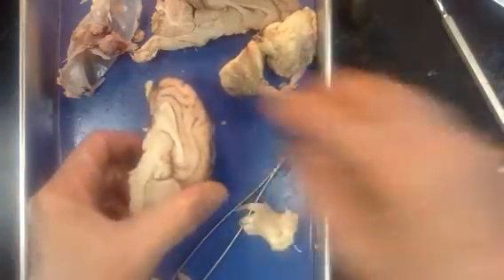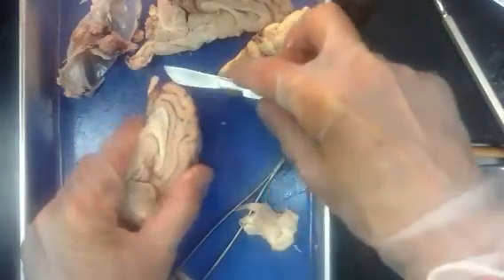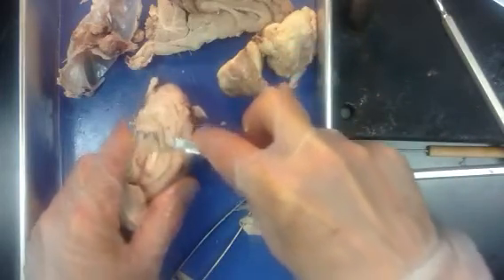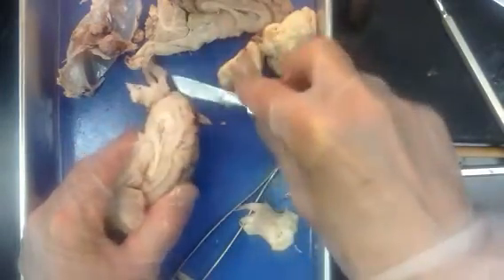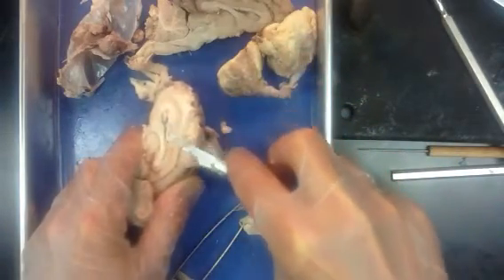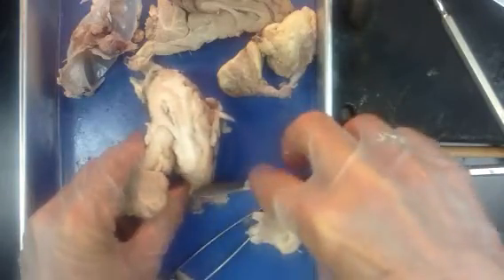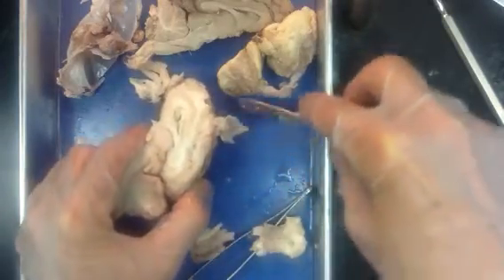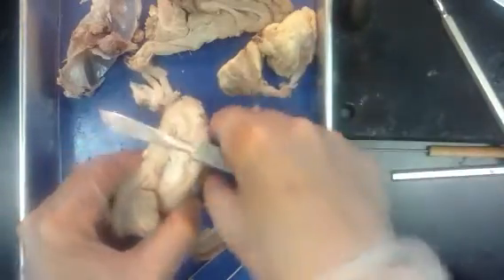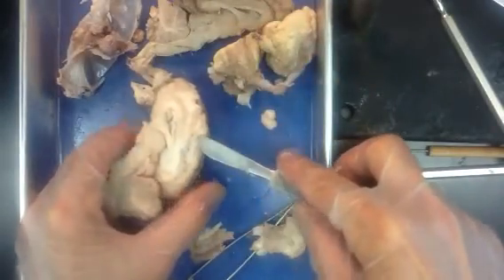So the next thing we want to take a look at is this corpus callosum, which is white matter. Anytime we see white matter in the central nervous system, and anywhere, it's myelinated, which means it has some kind of a glial cell. That would be a neurolemmacyte in the peripheral nervous system and an oligodendrocyte in the central nervous system that makes a lovely fatty coating to protect those axons so information can travel more quickly and more efficiently from gray matter to gray matter.